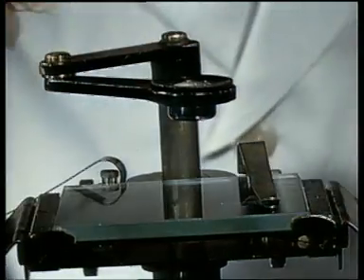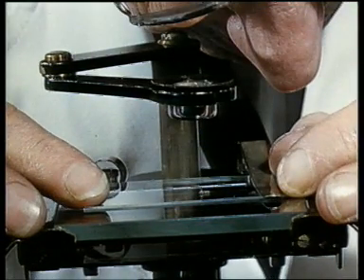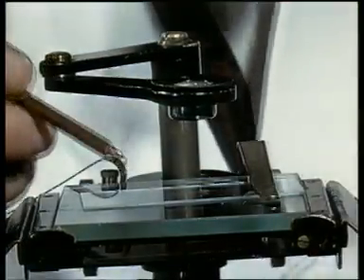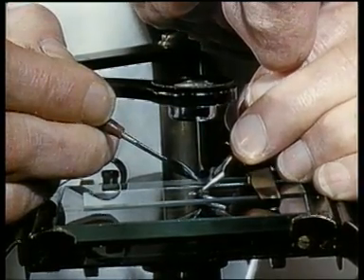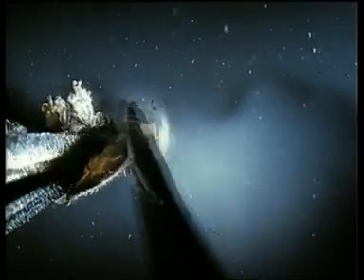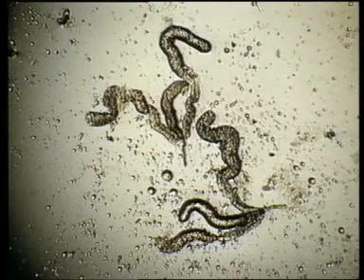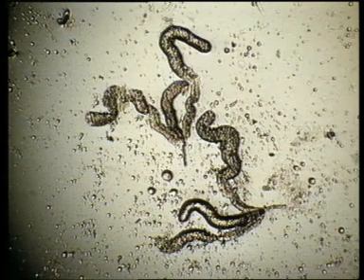The salivary glands are removed first, using a magnification of about ten times. The insect is placed on the microscope stage with its thorax to the right. A drop of saline is put on the slide, close to the thorax but not touching it. Holding the thorax firmly with one needle at a point just behind the glands, they are pressed gently out into the saline drop with the other needle. Each gland has three lobes, usually about a third of a millimetre long. If sporozoites are present, they'll be found in the cells and ducts of the glands.